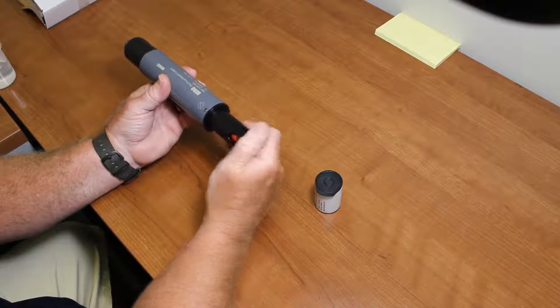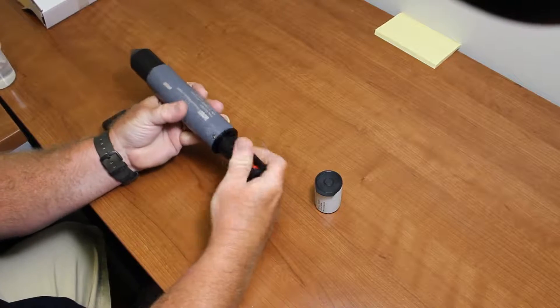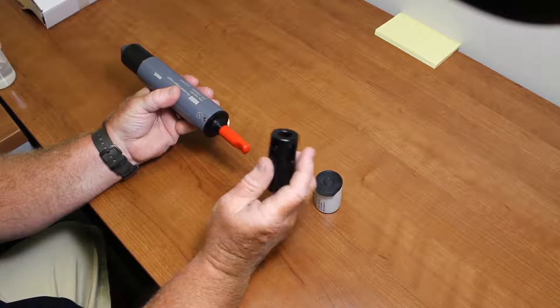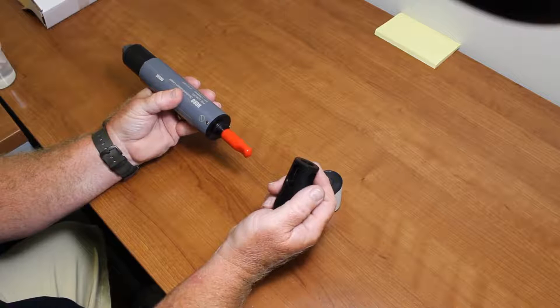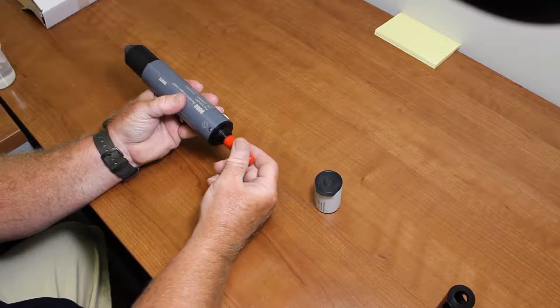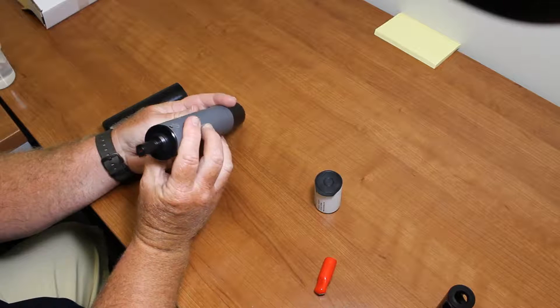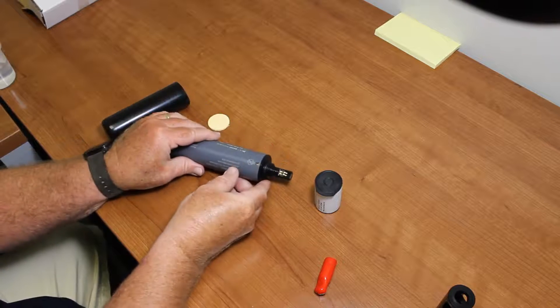The first thing we want to do is install the sensor cap. We're going to take the guard off. We're not going to use this guard — we're going to put an anti-fouling guard on here, which is an option. It has copper windings around it, which helps keep down fouling for the logger. This is the protective red cap that covers the actual sensor.